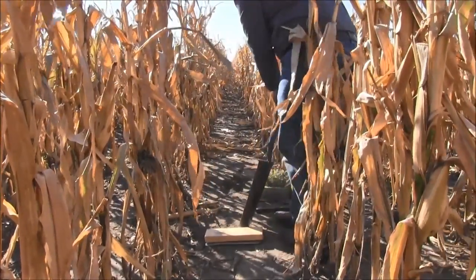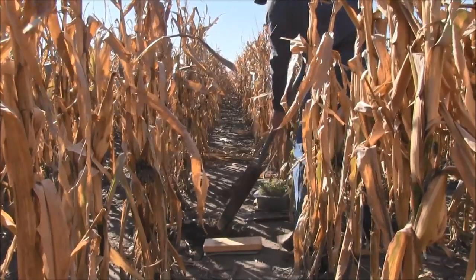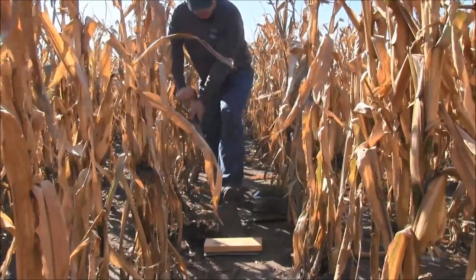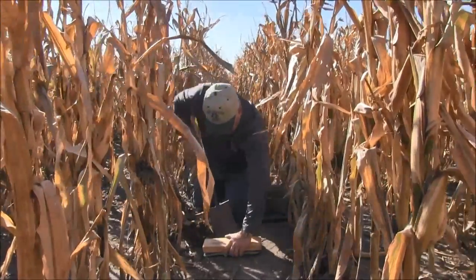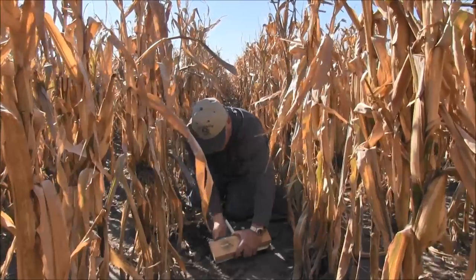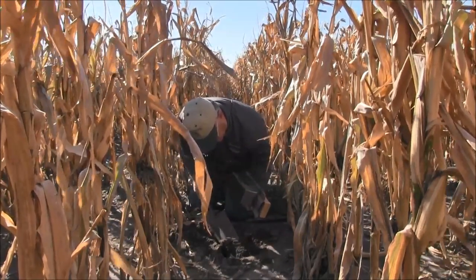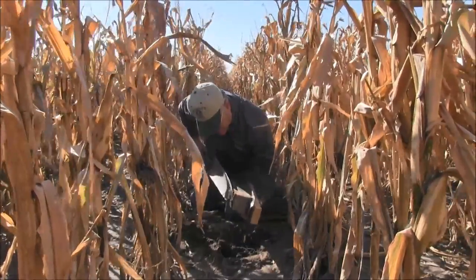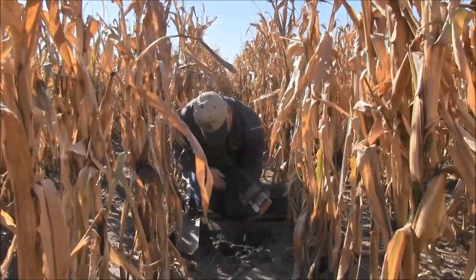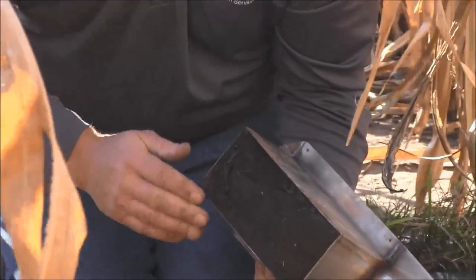I'm going to remove enough soil on the edges so I can get my shovel up underneath it. Keep that 2x4 on the top of it so that the soil stays in place as much as possible. Now we're going to lift that out. You can see here that it basically sheared itself off, unlike the other sample we had. As we start rolling this over and looking at it, the structure is a lot different on the bottom — very few macropores at all. Because of that soil structure, it's really not going to infiltrate water very well at all.